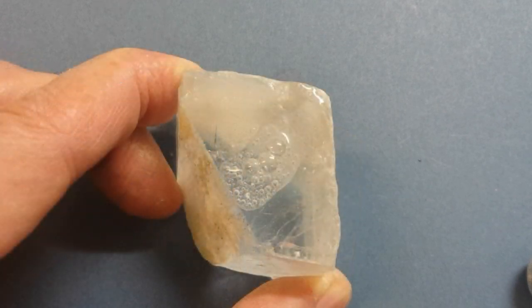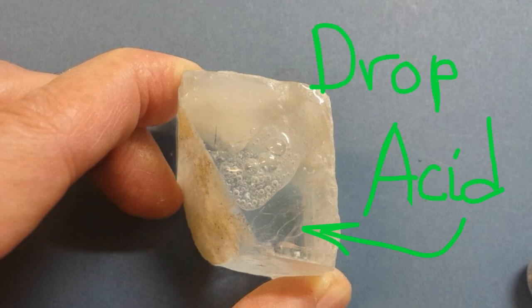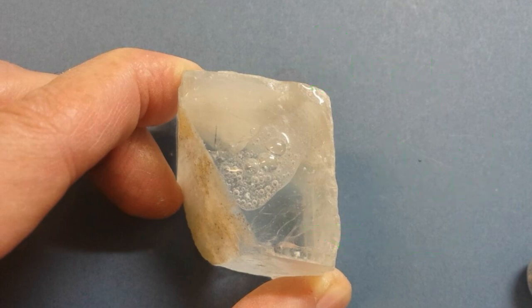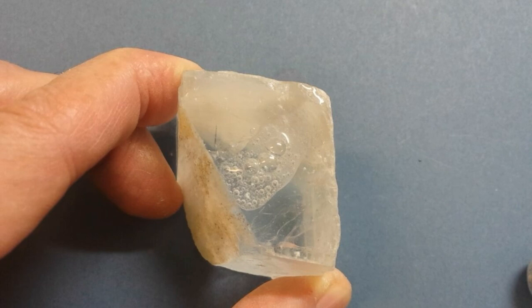So there's no reason why you shouldn't test every mineral sample with a drop of acid — it's really quick. If it strongly reacts, it's a definitive result for calcite and you know what mineral you've got. If there's no or little reaction, you've got to continue testing.